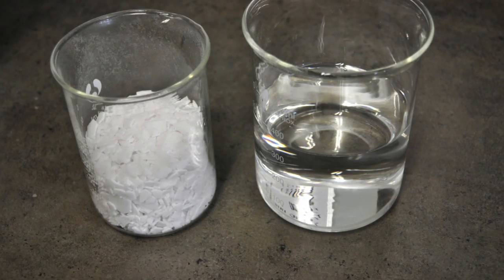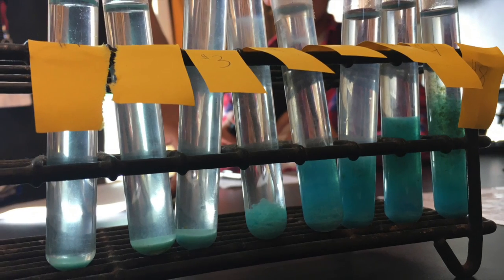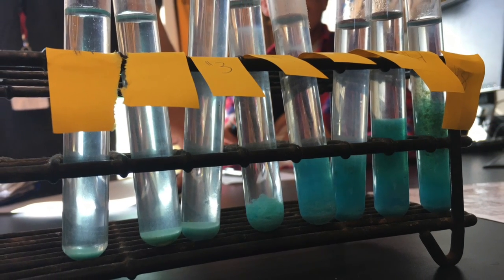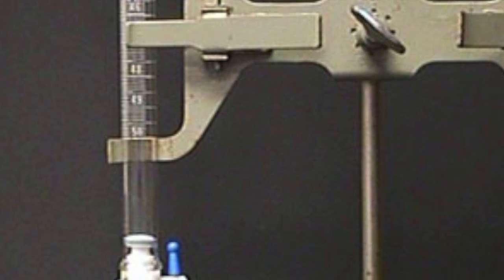In fulfilling this lab, we used 2 substances called copper sulfate and potassium hydroxide. To have each test tube reach the same height, we also added water. We set up 8 test tubes, numbered them 1 through 8, and used a buret to dispense the solutions with the right amount of substance.